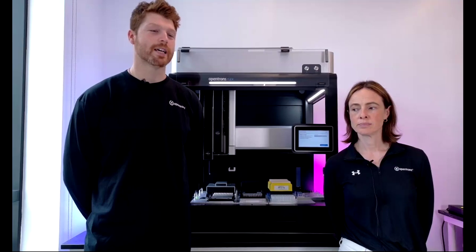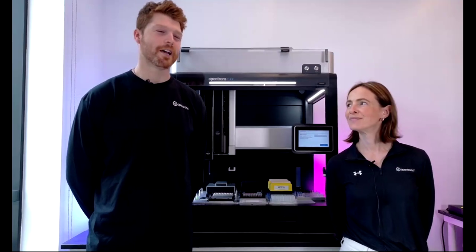Great. Christopher asked a very timely question. Can a custom pick list be called at runtime by the program such that different volumes can be aspirated from different wells of a plate? Nick, do you want to take that one too? It's right in line with your project. Happy to speak to that. So we've been working hard on expanding our runtime parameters repertoire to include uploading CSV files at runtime. So come our next major software release, this will be supported at runtime. Thank you for the question.